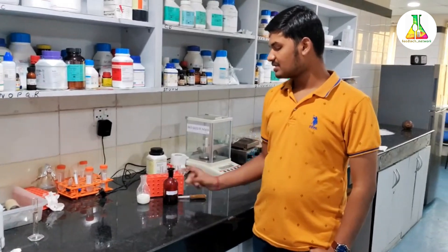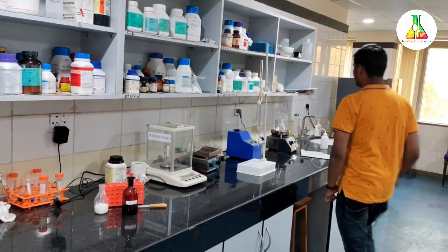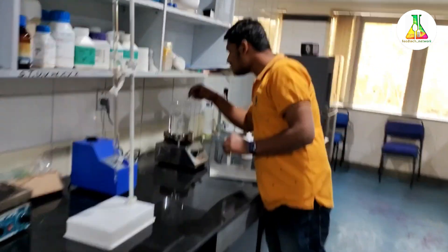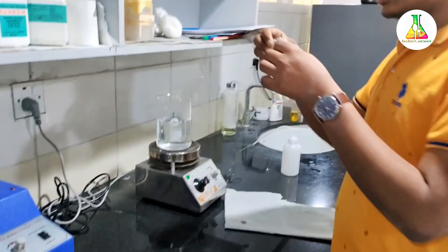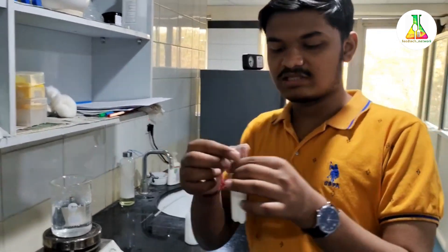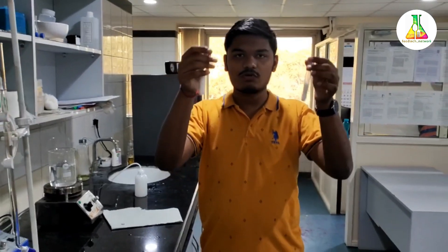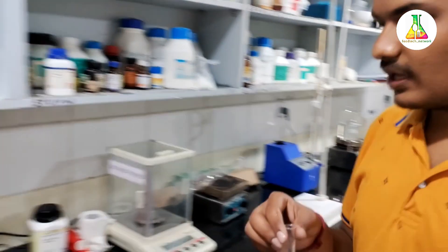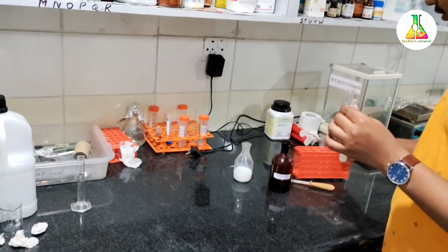To have the sample prepared, we kept it in the water bath and we took two different samples of milk. Now let us find which among these is adulterated. It has reached around a temperature of 37 to 40 degrees Celsius, and we will add iodine. Let me put it into this rack.